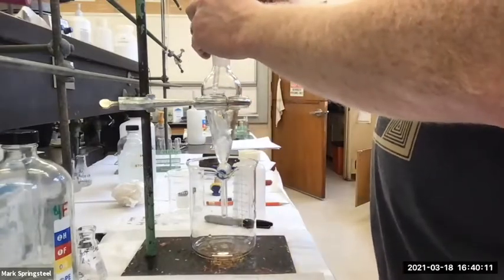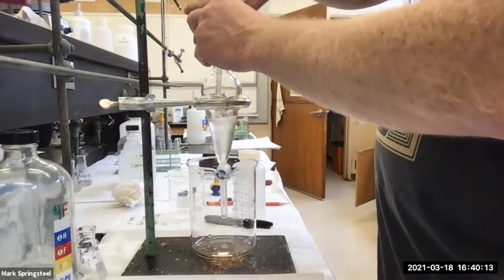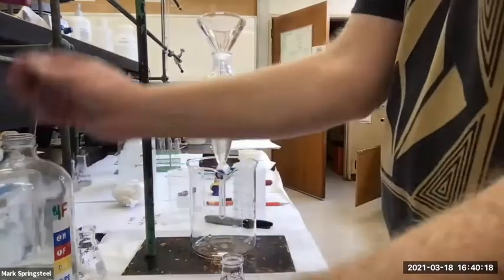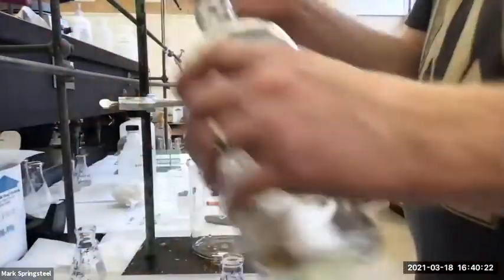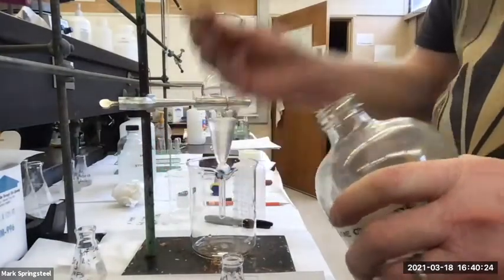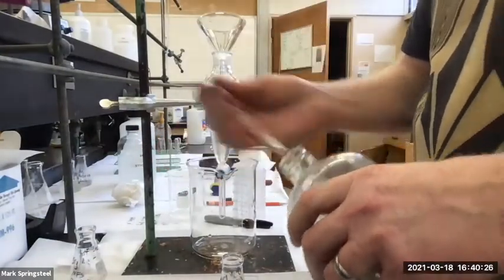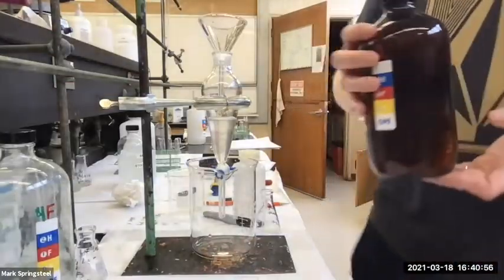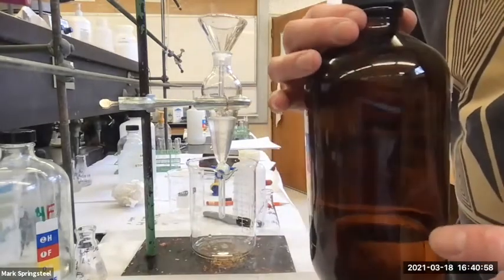And then what should I do? I'm using the separatory funnel to start my drying of the organic layer. So what am I going to do to dry the organic layer first? What technique am I going to use? I refer to it as a pre-dry. What's this bottle? Does anybody remember?